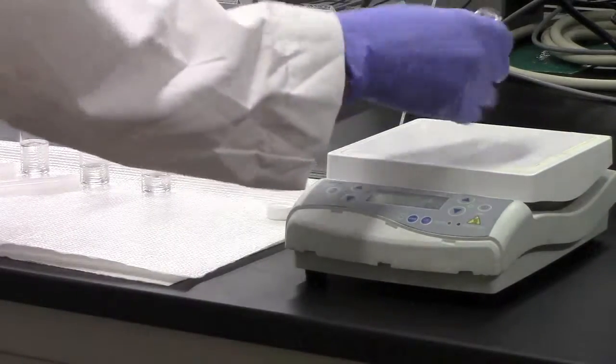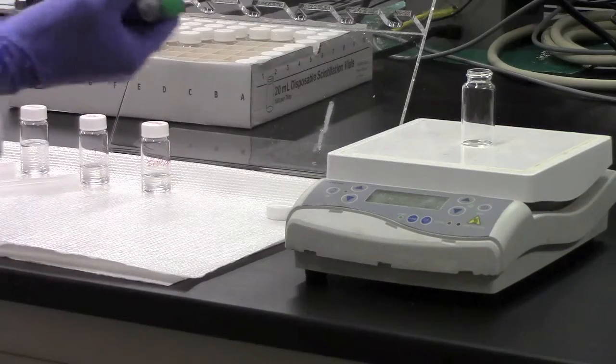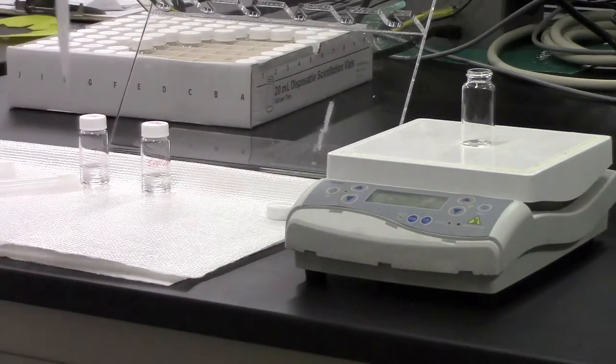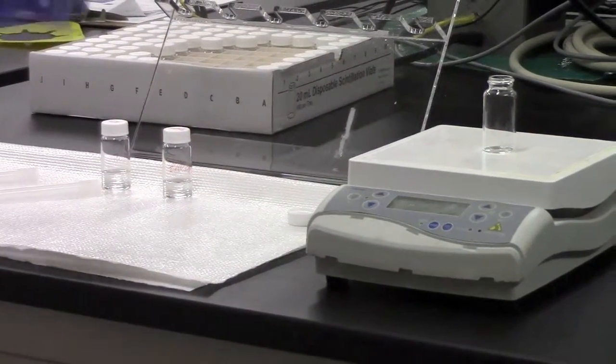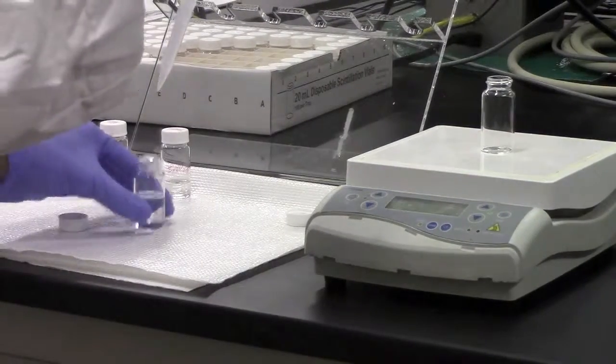I've got a vial sitting on top to which I'm going to add 4.6 milliliters of ethanol using a pipetter.